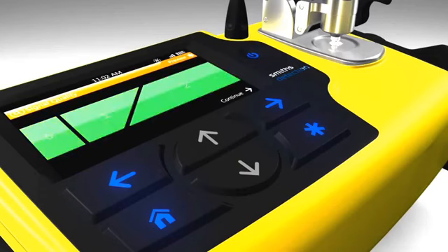The same red and green indications are provided when the system is switched into touch to sample mode with the second Diamond interface. From this screen, the user also has the option to select the star key to preview the infrared spectrum in real time. Finally, the user selects the right arrow key to initiate the data collection process.